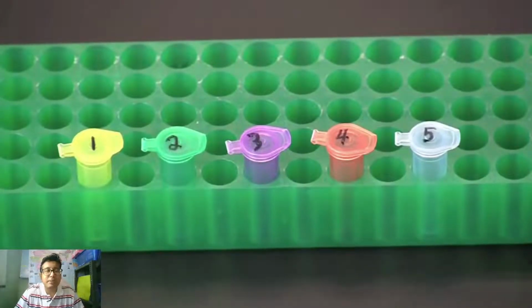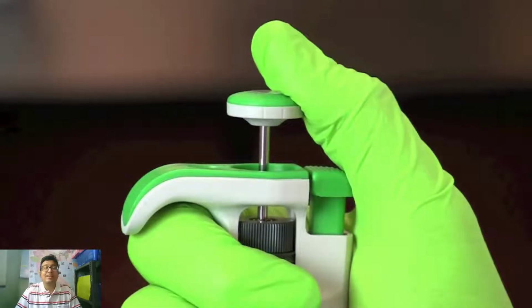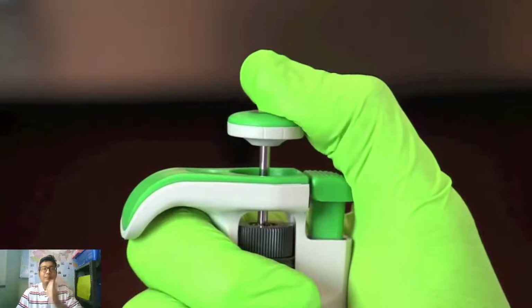These are the samples that have been prepared previously, and in this case DNA samples are prepared with the help of dye, okay. So, we need to mix the DNA staining dye with the DNA. These dyes are often fluorescent dyes and we will use a micropipette.